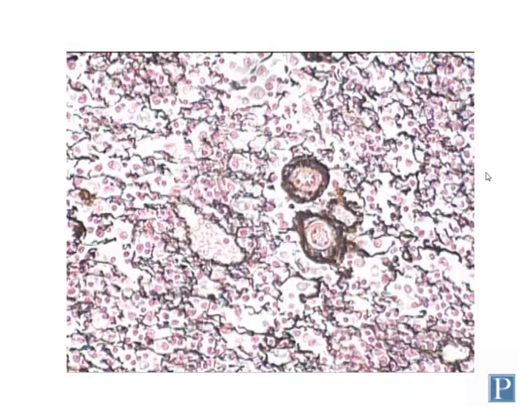This is a section of reticular connective tissue, another type of adult connective tissue. You can find this in spleen and liver and some other structures. This particular section is from spleen that has been perfused, which washes out most of the red blood cells. Not all of the red blood cells have been removed, however, you can see lots of those. These are the small disc-shaped cells here. But it leaves the fibrous stroma intact, and that stroma is composed of reticular connective tissue.